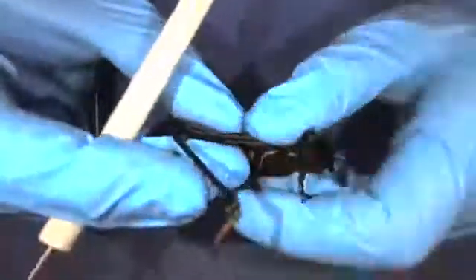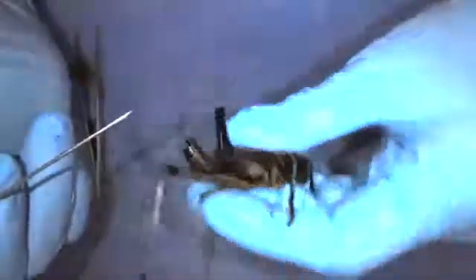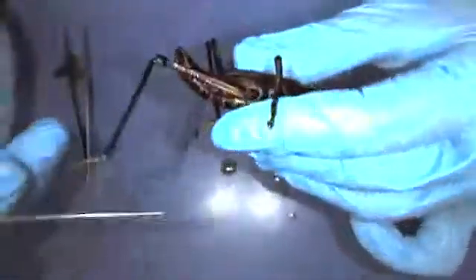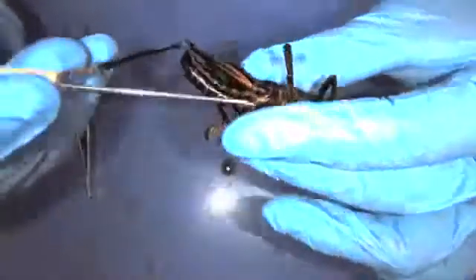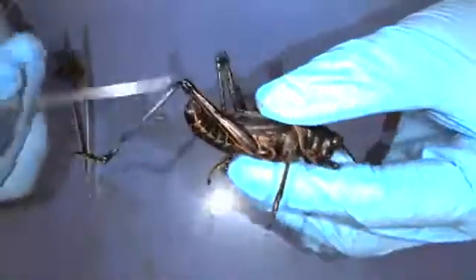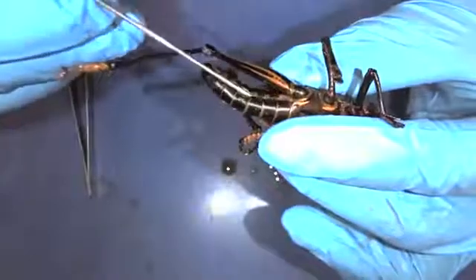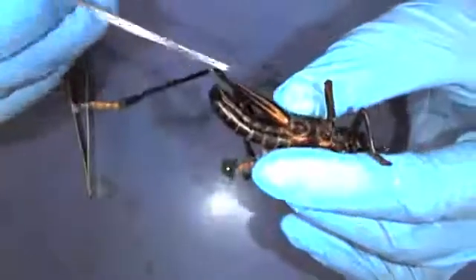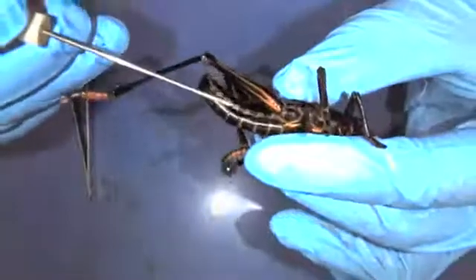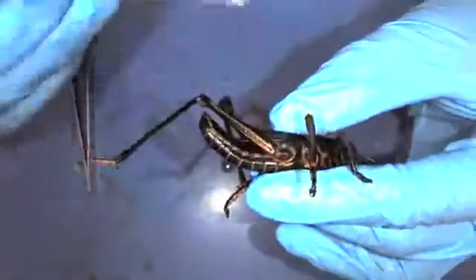Most living organisms on Earth need some sort of mechanism to breathe. If you said lungs, you're correct — we use lungs for gas exchange, breathing in oxygen. Now, insects like our grasshopper don't have lungs exactly, but they have something similar. Along their abdomen they have really tiny holes called spiracles — tiny openings that connect to trachea, which are special tubes that help with gas exchange, giving them the oxygen their body needs.